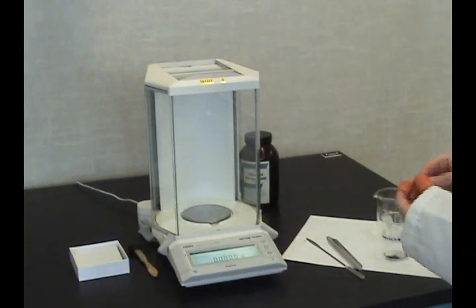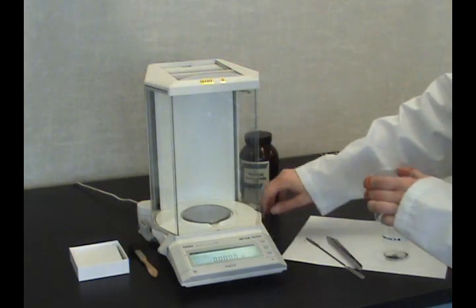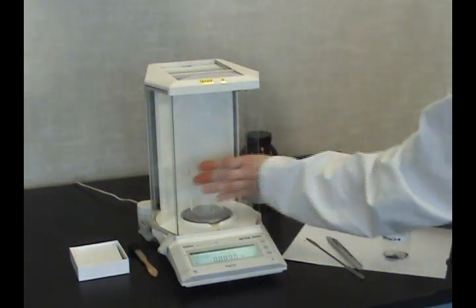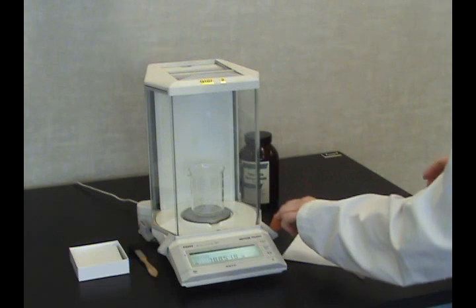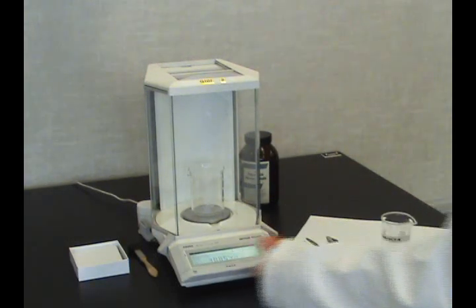Use finger cots to handle your weighing vessel so no oil is transferred to add weight. Use an analytical balance to get a more accurate weighing. Tare the vessel.